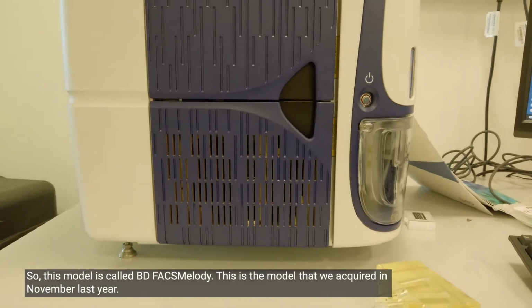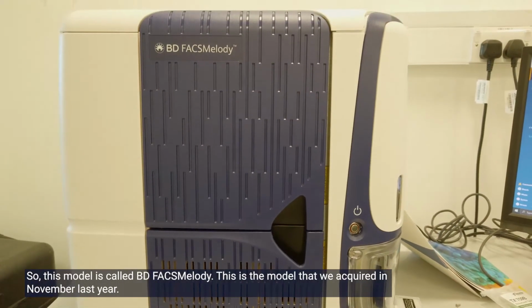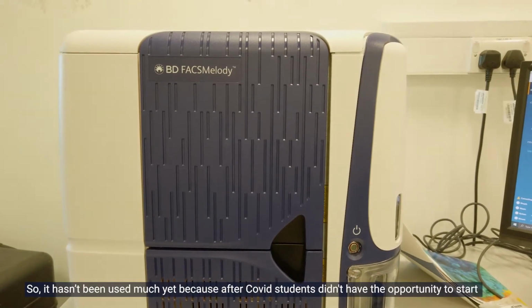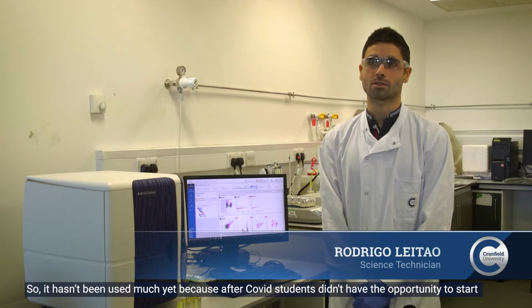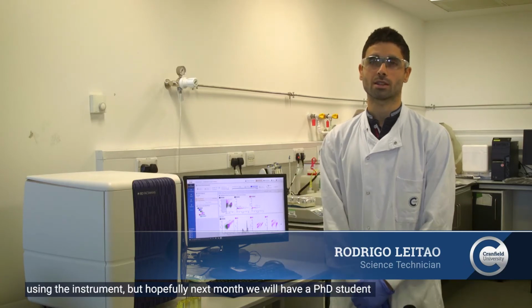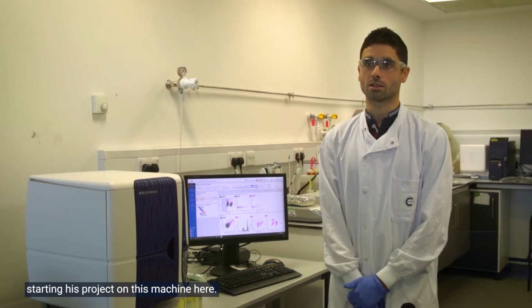So this model is called BD FACSMelody, a model that we acquired in November last year. It wasn't much used yet because after COVID, students didn't have the opportunity to start with the instrument, but hopefully next month we will have a PhD student starting his project on this machine here.